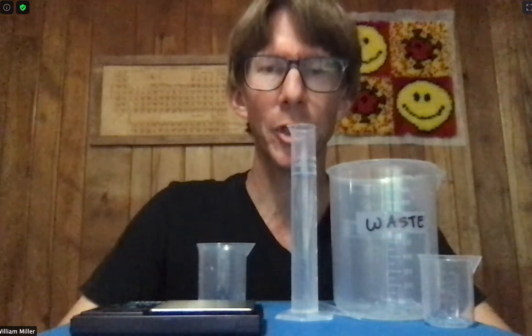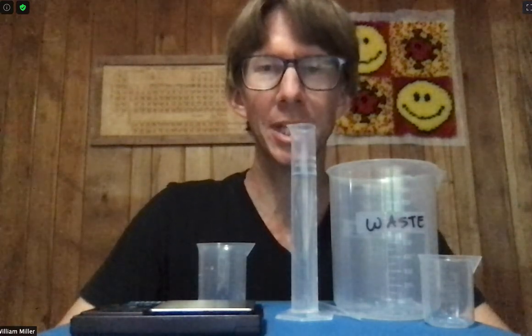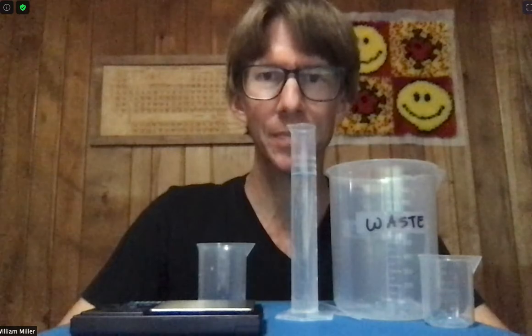This is experiment three: density of saline solutions — measurement of density and percent composition of saline solutions.